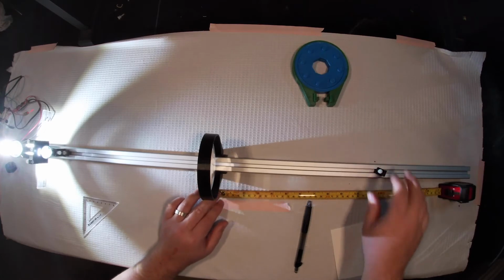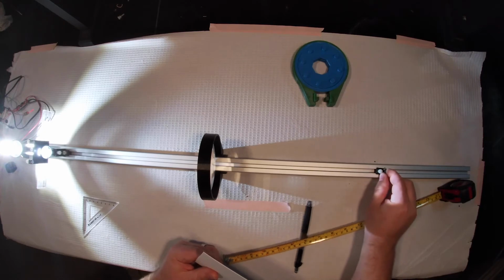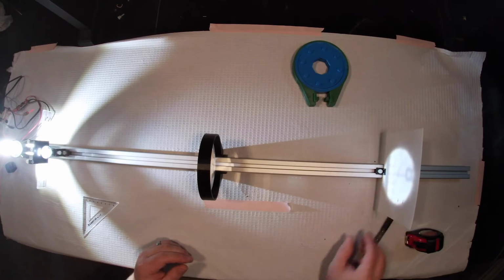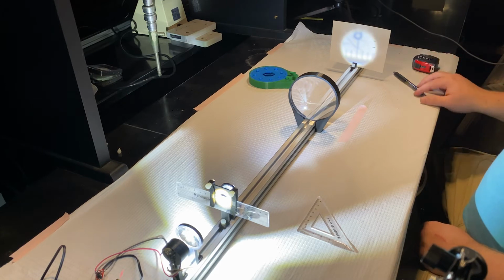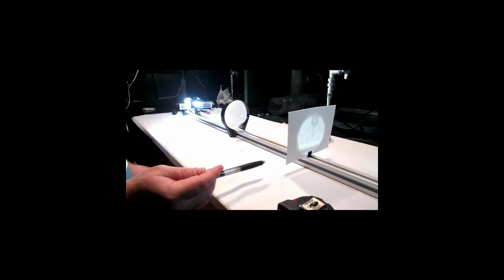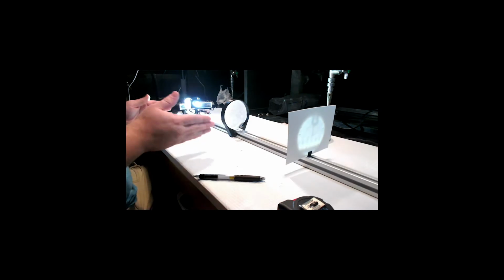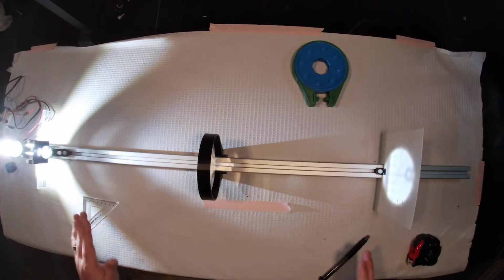So the first thing that we'll do is just sample our focal space and see how close we are to forming an image. All right, not too bad. All right, so you can see right off the bat, we have something of a blurry image being formed. You can see maybe a number, a couple gradations. So we're pretty close with these measurements in terms of 300 and 300. That's a very large distance, with a lot of room to play.